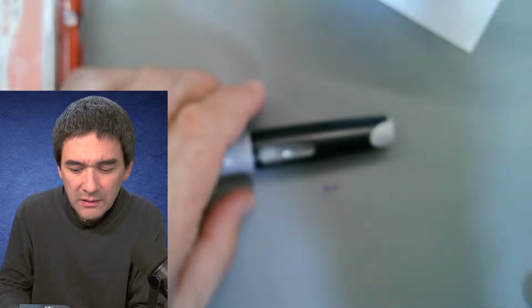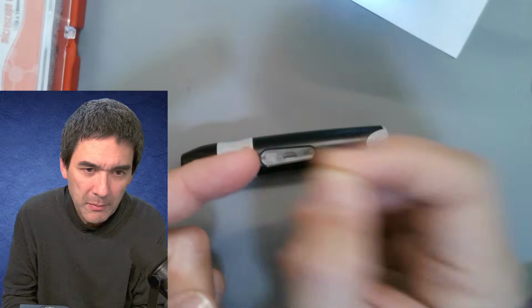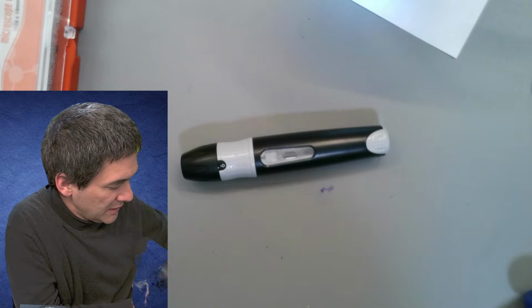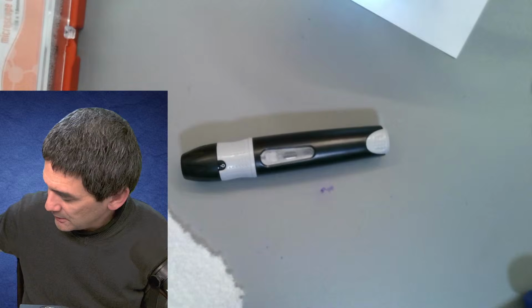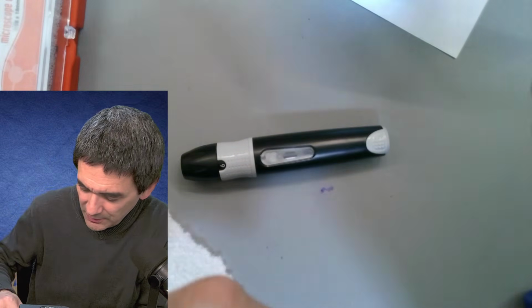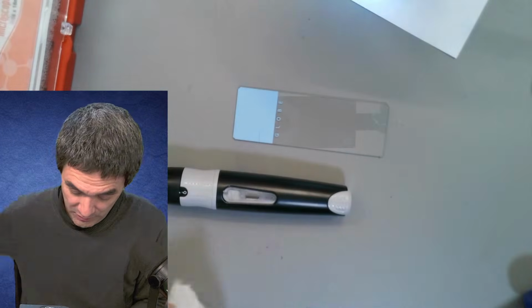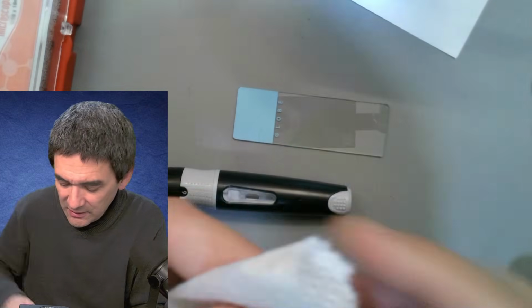Some of you may remember that I used to prick myself like this, and this was psychologically not so easy. For this reason, I've now got this, which helps me draw some blood. Blood cells are 8 micrometers in diameter, and therefore I would like to see if this microscope is able to resolve those or not. I really don't know. So I'm going to add a little bit of alcohol here simply to disinfect my finger.